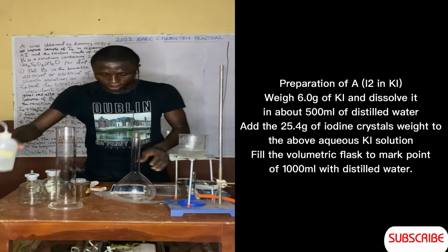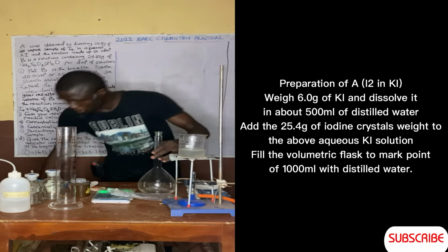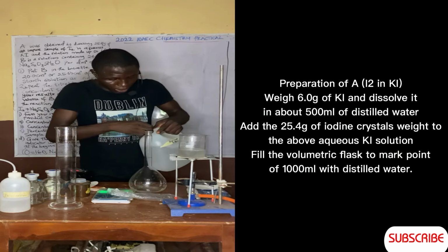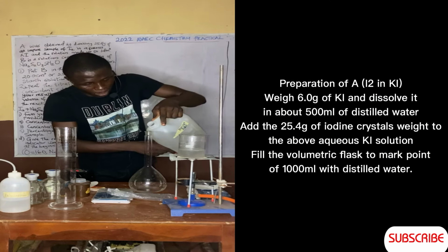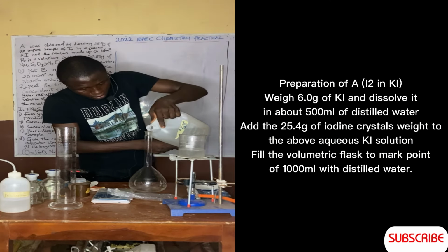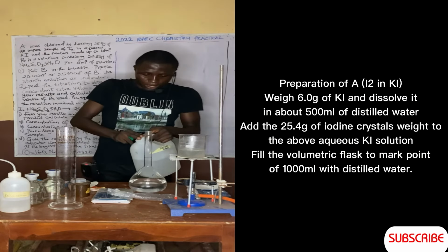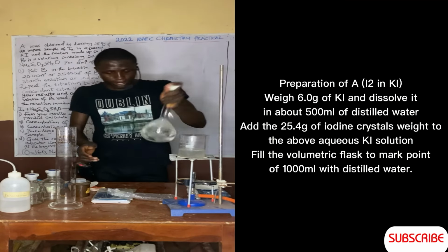Now fill this with distilled water, at least about 400 cubic centimeters, before you add your iodine crystal. Because this crystal will not dissolve in distilled water directly. You have to dissolve it in potassium iodide. So this is our potassium iodide now. Let me just shake it a little bit.